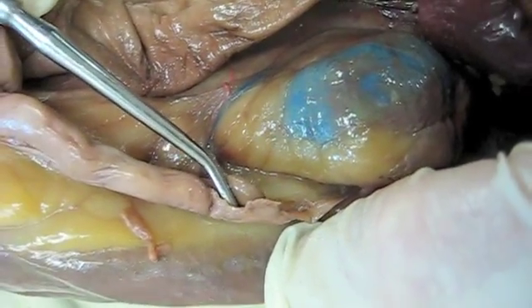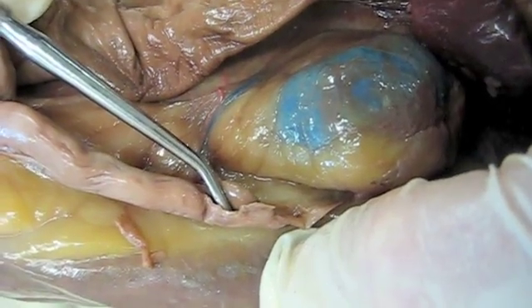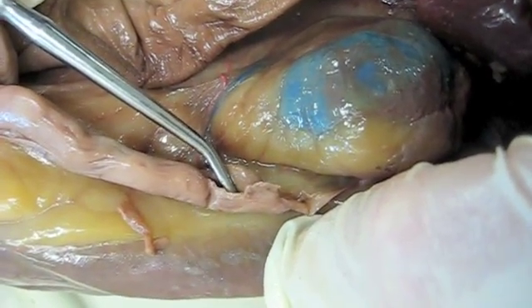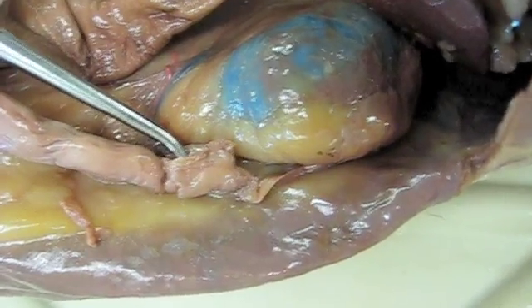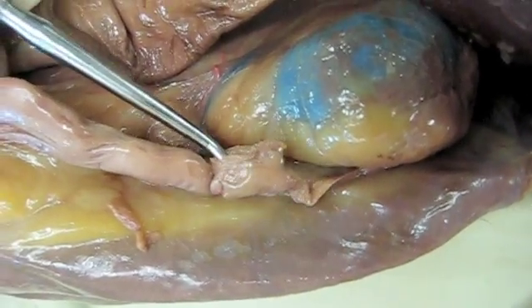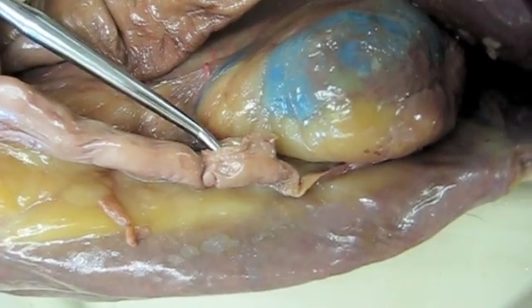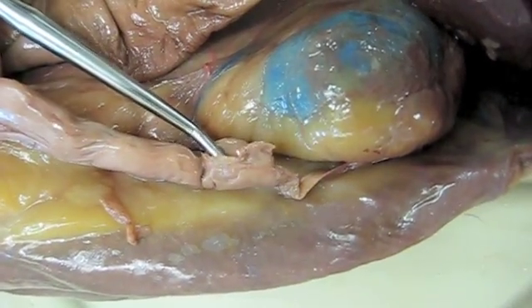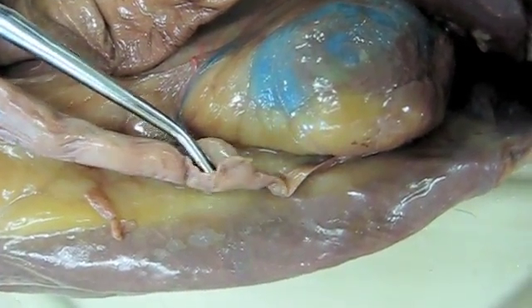Student: Is it the actual ovary membrane? Instructor: No. The membrane that supports the ovary is the mesovarium. This membrane here is supporting the oviduct, and that is the mesosalpinx.